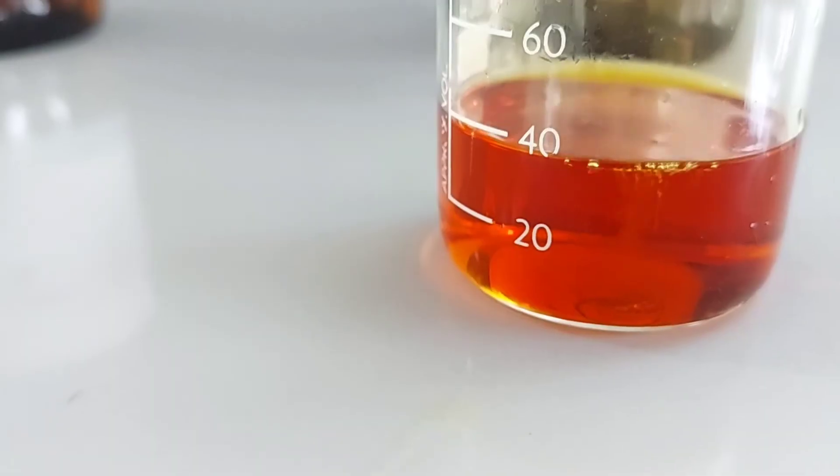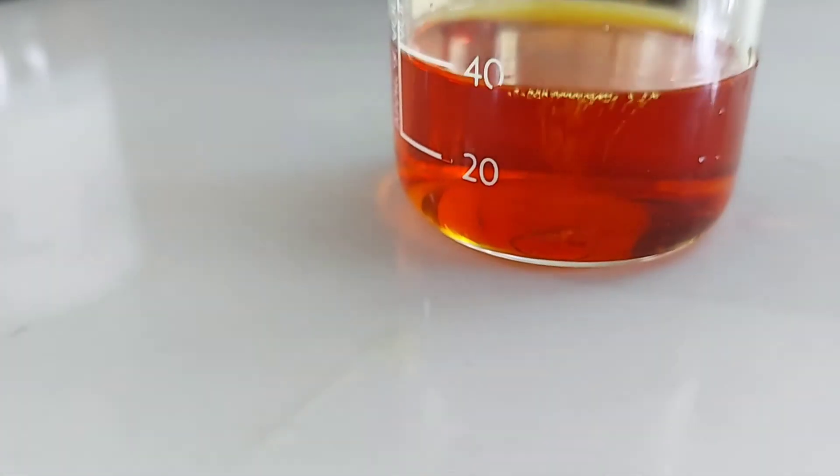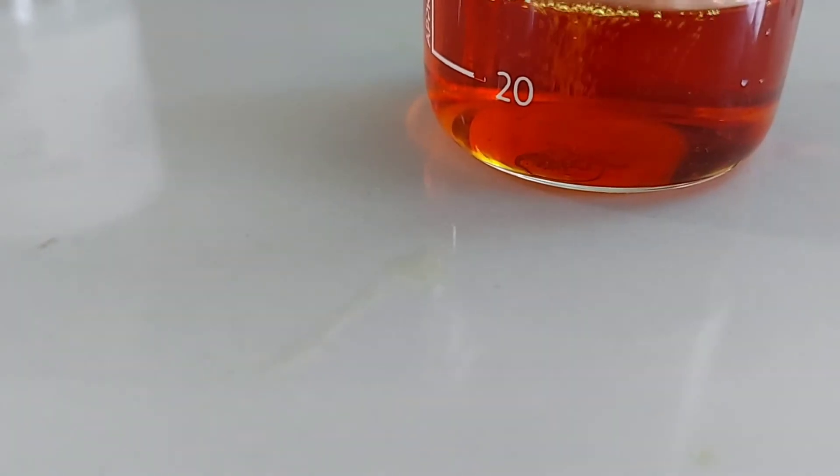You can see beautifully this little gold piece I added in the solution is almost completely dissolved in the solution.